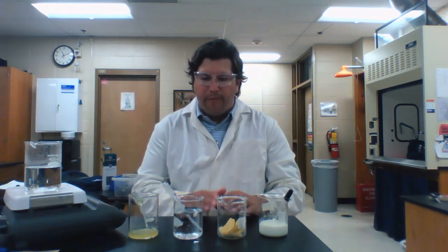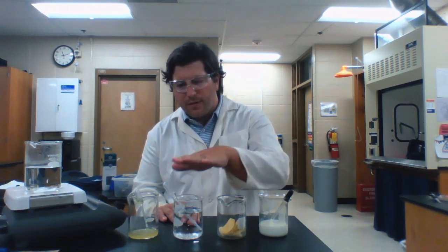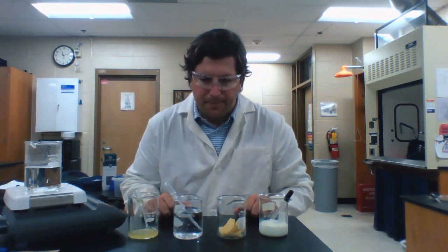So we're going to perform 4 different tests on each of our 4 food items. And the 4 food items we have, looking at your table, just going from top to bottom, I've got milk, potato chips, Sprite, and egg whites. And we're going to perform all of our tests on each of our 4 food items.